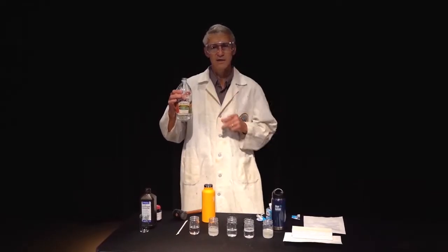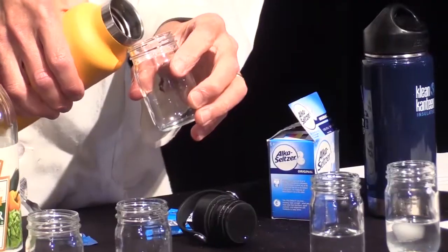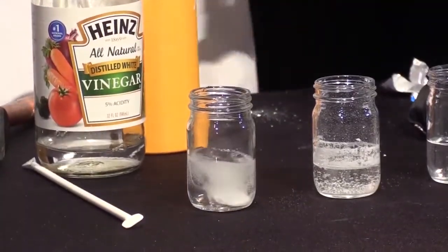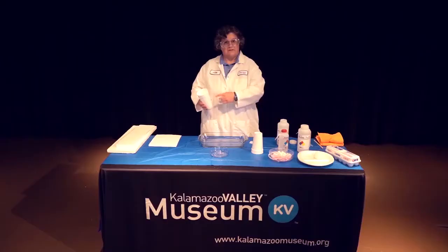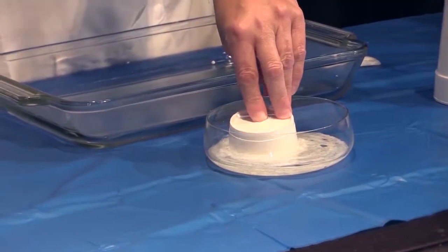Doug Williams conducts a series of experiments to show how reaction times can be changed. In the end, it is the Scarecrow who figures out how to melt/dissolve the Wicked Witch of the West using water. Julian Bauer has a much more believable way using acetone.